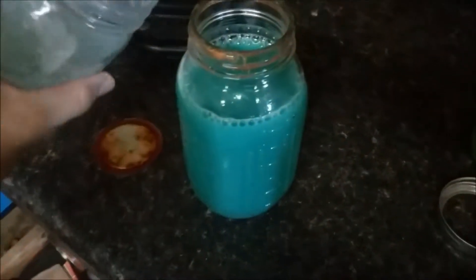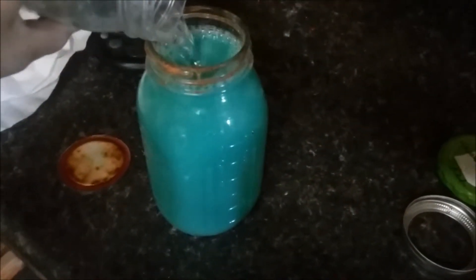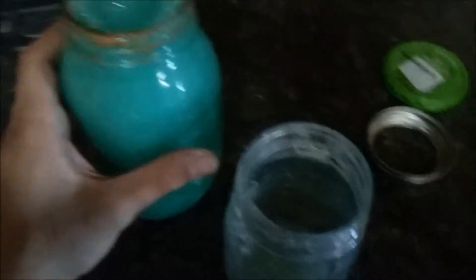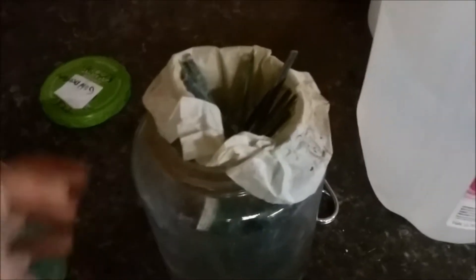What I'm going to do is transfer all this liquid into here. I'm going to change out the filter so this won't be used anymore, except for the final steps. I'm going to put one of these on and get the filter again.